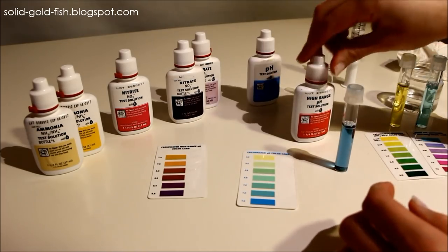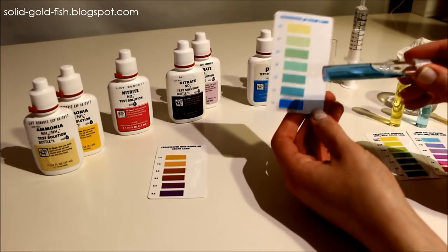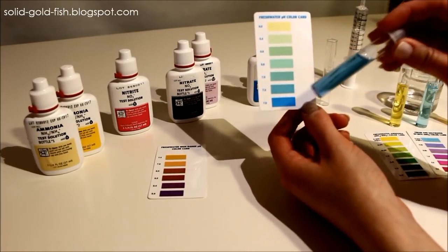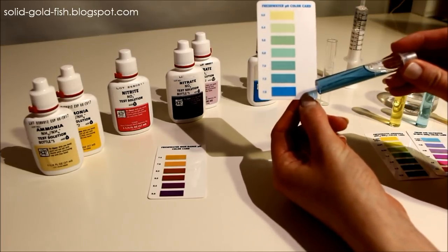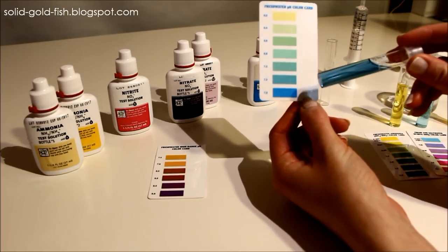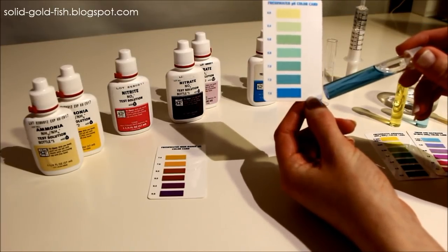The pH ones can actually be read right away, you don't have to wait five minutes. My pH is always really high. As you can see it's reading at 7.6 right now, which is the highest this test will go. If you get this reading that's an indication that you should definitely check with the high range pH as well, just in case it's actually above 7.6.